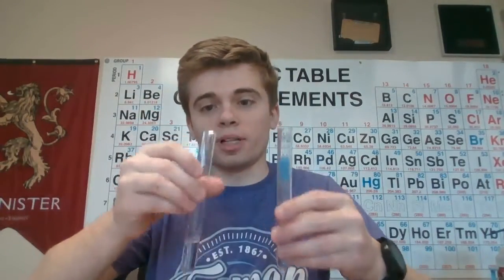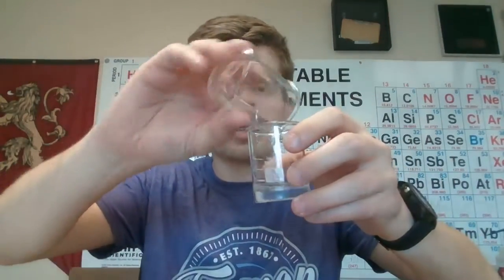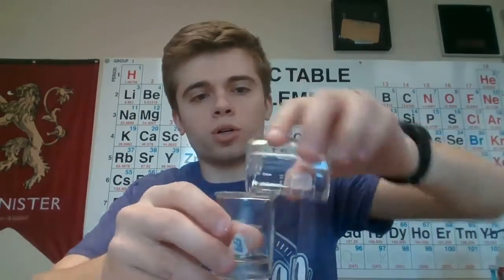Okay, now we're doing trial 2. These two are at 15 degrees Celsius. I measured out 5 milliliters of each, so I'm going to pour the A into A and the B into B. As soon as I mix them, I want you to start recording the time. I'm going to mix them now. Record that time and see how long it takes for the color to change to blue. There we go. So record that time. Once you record the time, come back for our next trial.